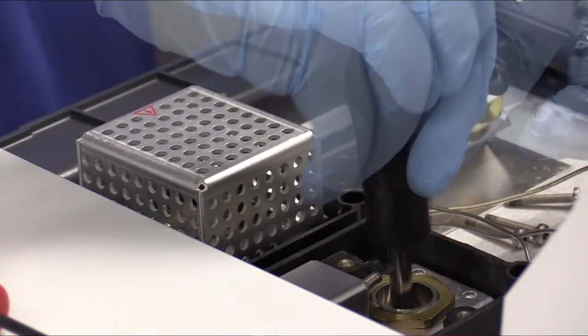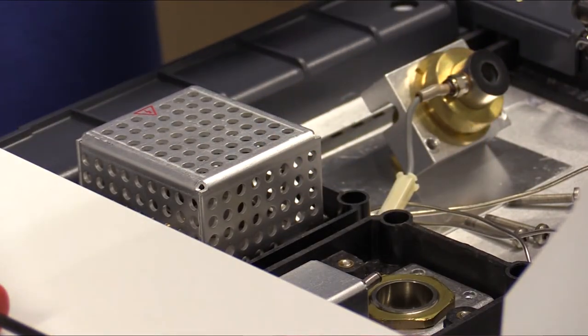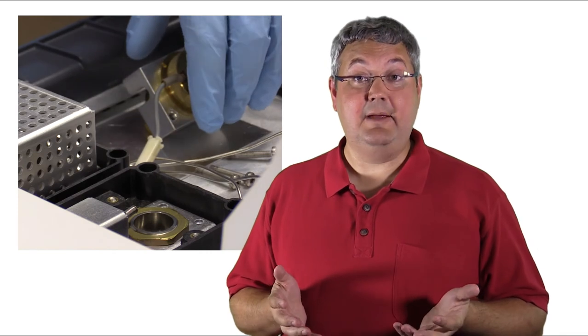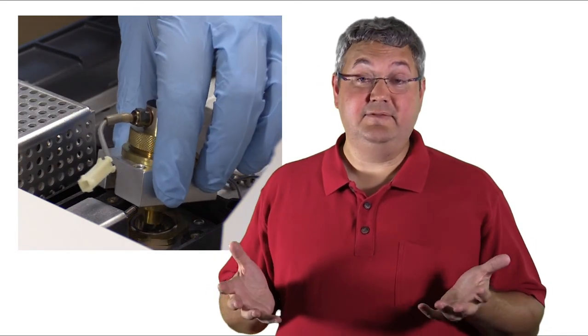Once it's out, we can clean it if that's our goal, or we can grab a new one to do a full replacement. And once we're ready to put everything back together again, we will just follow those same steps in reverse order. And that's it. That's all that's involved with replacing an FID jet.